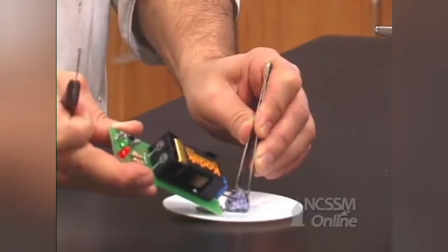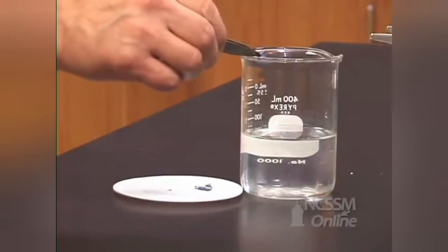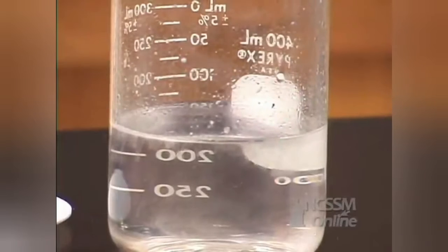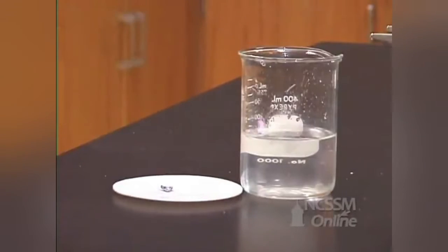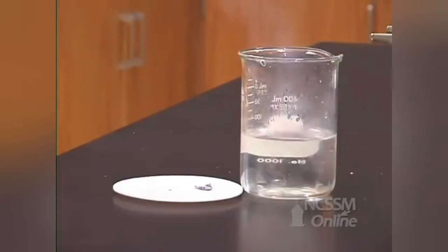The potassium is a metal and is an excellent conductor of electricity. If we add a piece of potassium metal to water, we see that it reacts much more rapidly with the water than the sodium. As you go down the column, the ionization energy decreases and the metal reactivity increases.